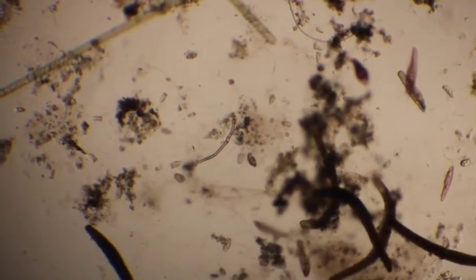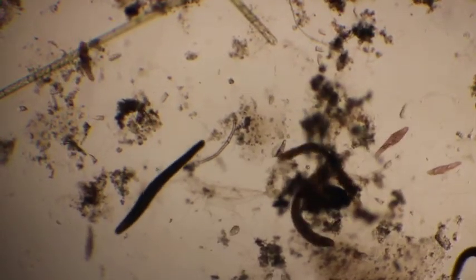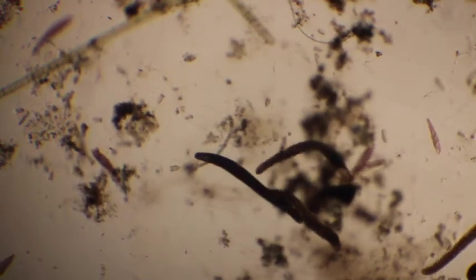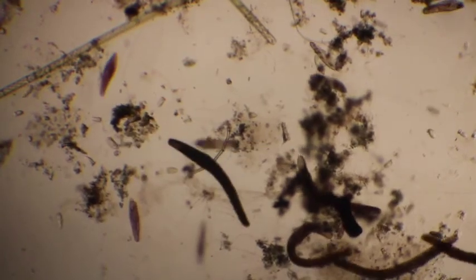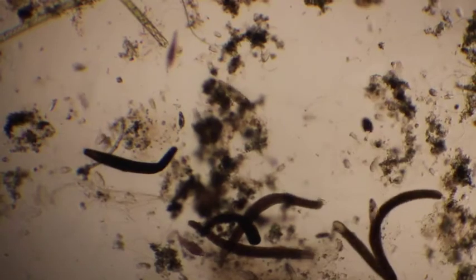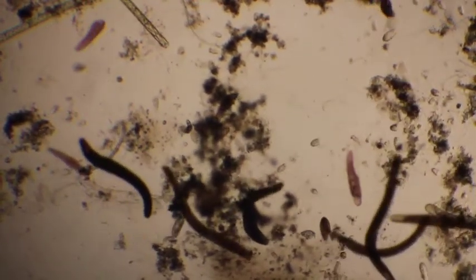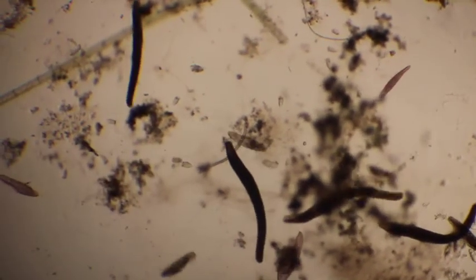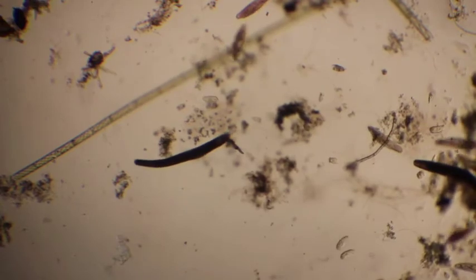The rose-colored ones in here are called Blepharisma. You can see a lot of Blepharisma in there. The ones that are the same size as the rose-colored ones that are not rose-colored, those are Parameciums. You can see a nice Paramecium there in the center. See the rose-colored one being the Blepharisma there. Then you have smaller ones, which are Colpidium and various other guys.